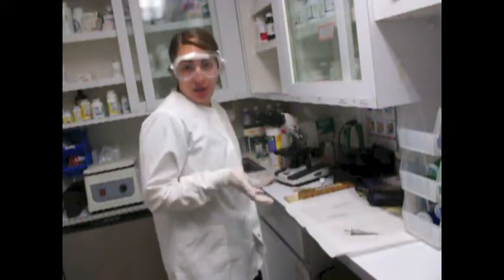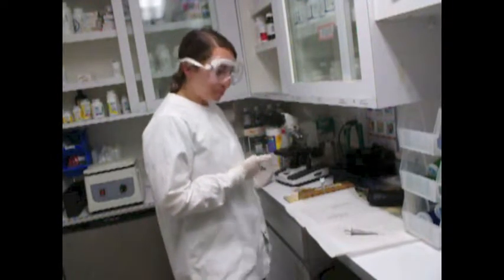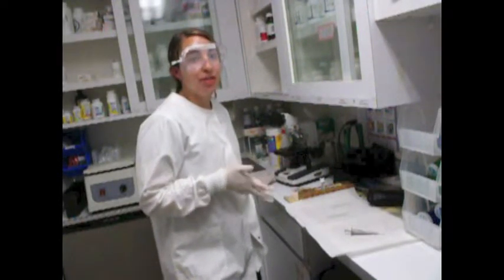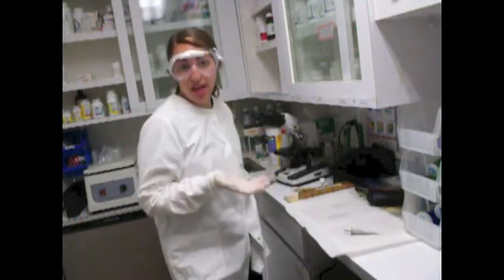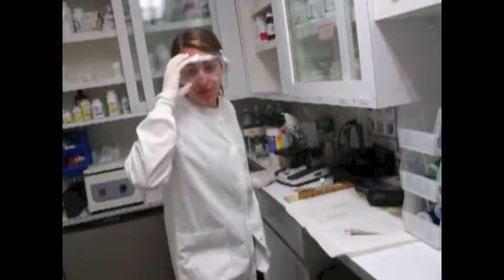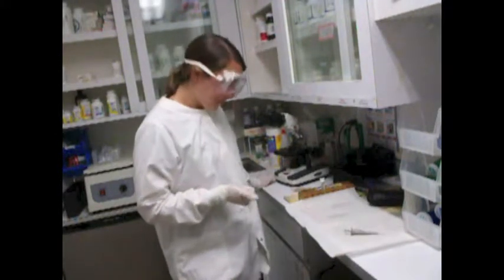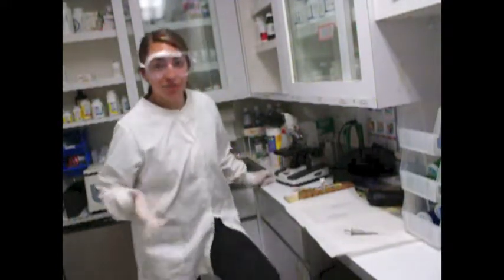So things that I am looking for when looking at this urine slide are any casts, crystals, any cells, or anything abnormal. Casts could indicate renal disease. Some patients do not have casts in their urine. That necessarily does not mean that they do not have renal disease. Different types of casts have to do with how long they sit in the renal tubules. Crystals are very common in urine. There are many different kinds of crystals.